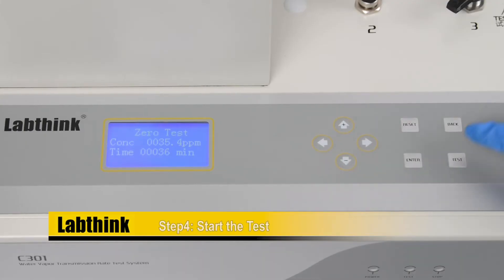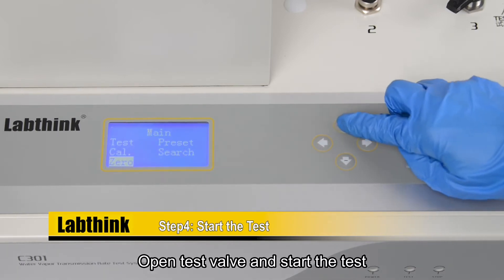Step four, start the test. Open test valve and start the test.